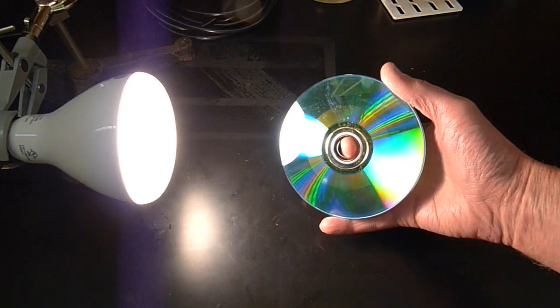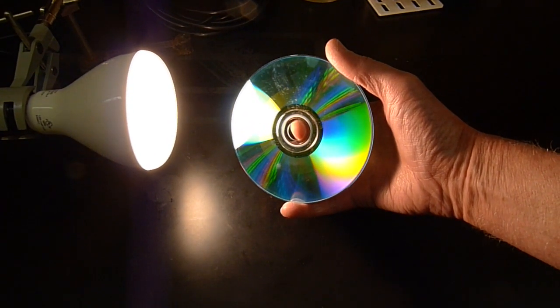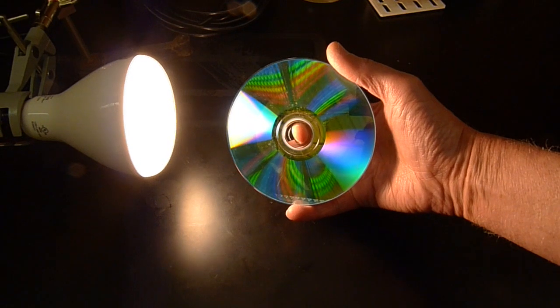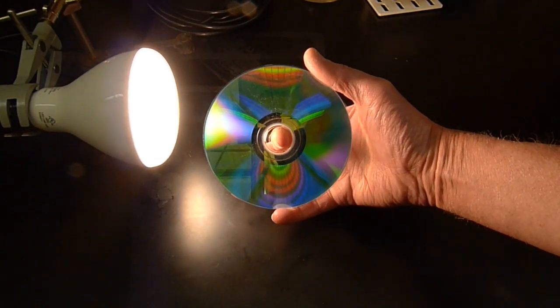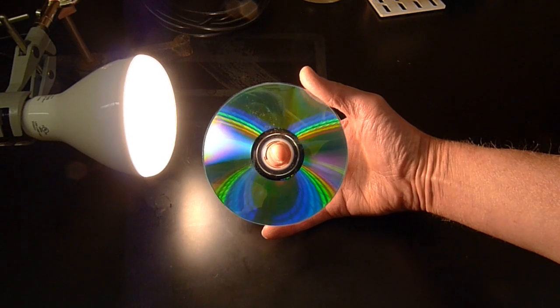And if I hold this against a light, if I tilt this slowly, you can see the color spectrum on the right side of that disk. And if I do it carefully, there's indigo or violet, blue, green. If I keep tilting it, then it becomes yellowish. It's hard to see the yellow. And then orangey and red.